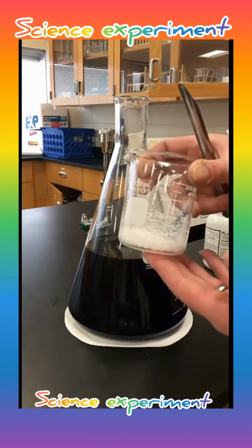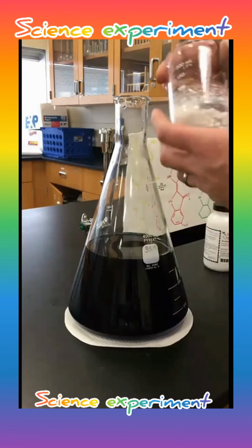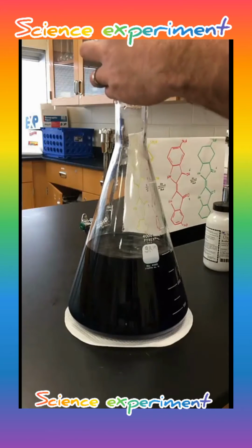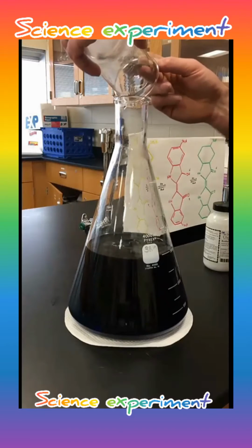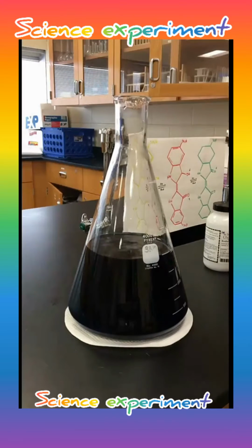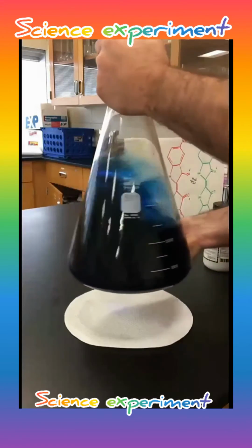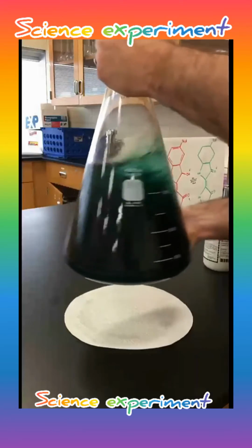The next ingredient is sodium hydroxide. Sodium hydroxide is also called lye, and it's in most drain cleaners. We'll give it another swirl here to get it nice and mixed, and it's also going to start to show us a little green color.